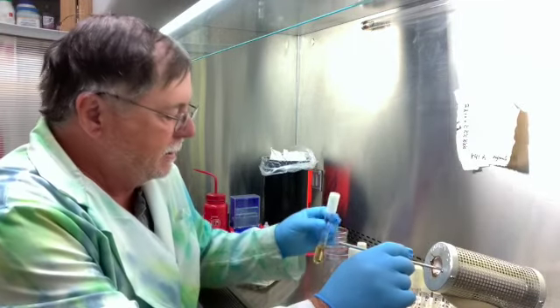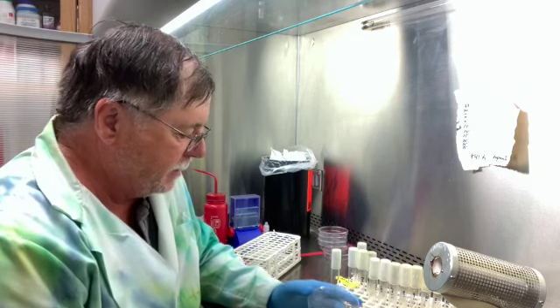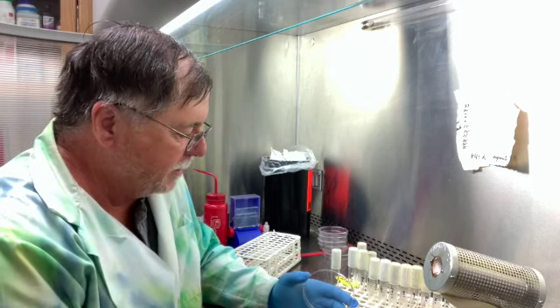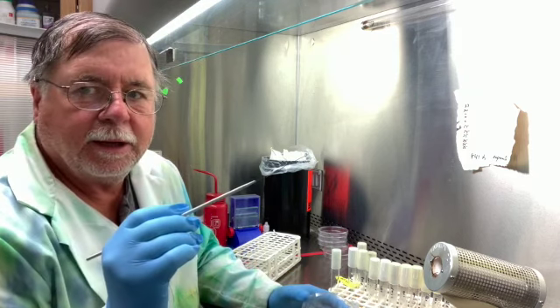So I'm going to take a loop, incinerate it, sterilize it, and I'm going to go into this, number 1, and all I do is just get a little bit of bacteria. It doesn't take much. You can hardly see it.